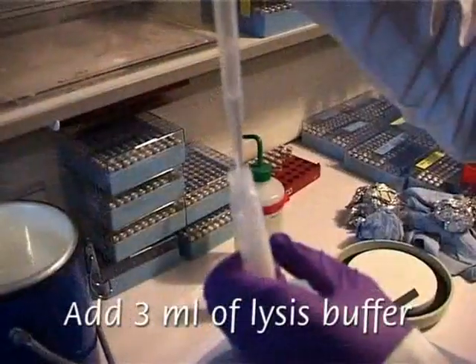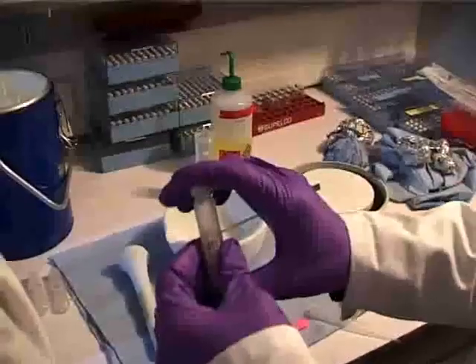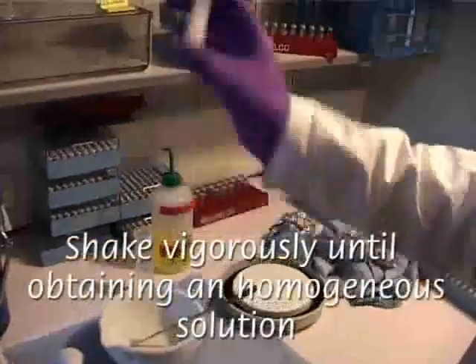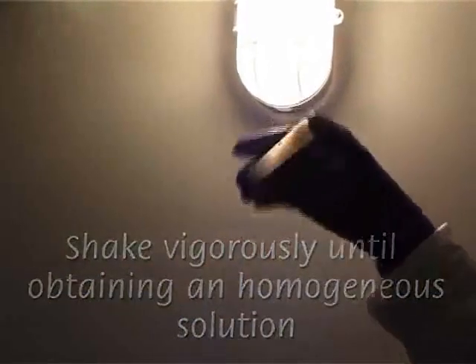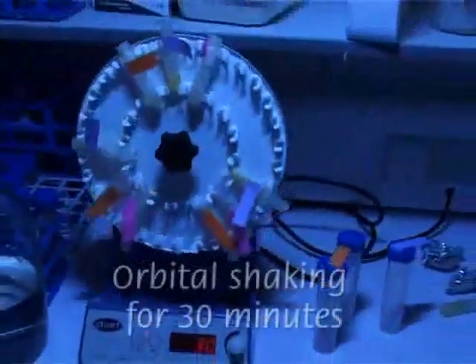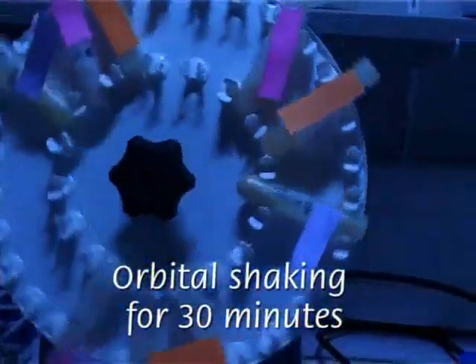Lysis buffer containing SDS and different protease inhibitors is then added. The tubes are then shaken until a homogeneous solution is obtained. Then the samples are shaken for 30 minutes in the cold chamber to be further homogenized.